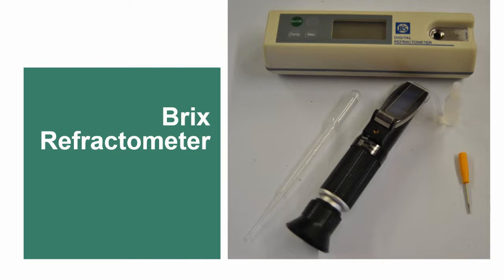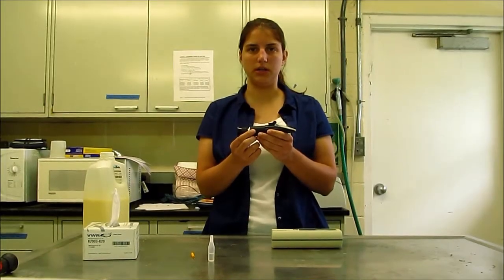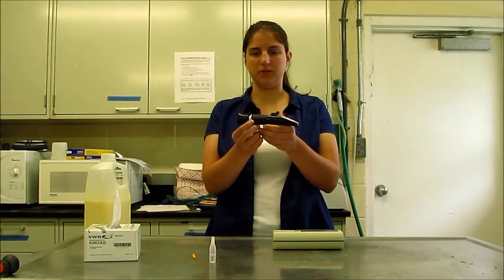In this video, Sonia Gelsinger will demonstrate how to use a Brix refractometer to test colostrum quality. One of the tools that we can use for measuring colostrum quality is a refractometer. This is an optical version of the refractometer.